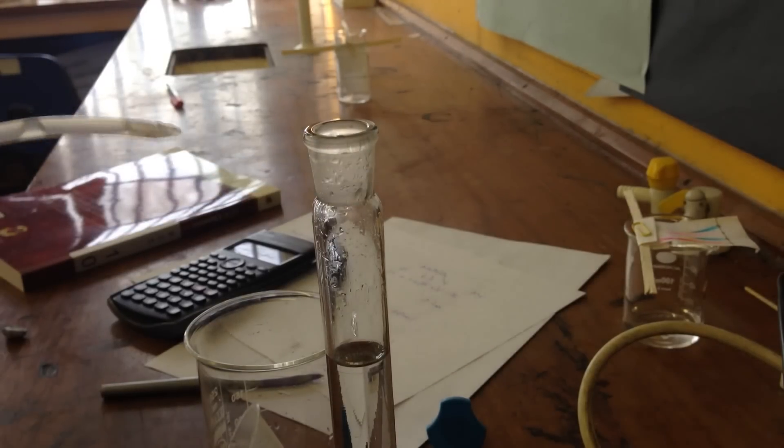Drop, drop, drop, and there. The bottom of my meniscus is on the line.